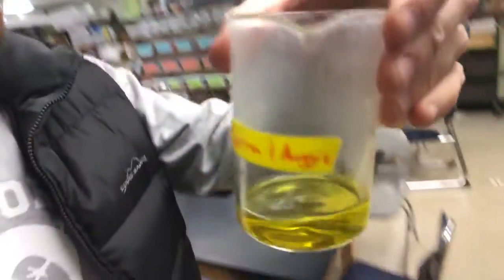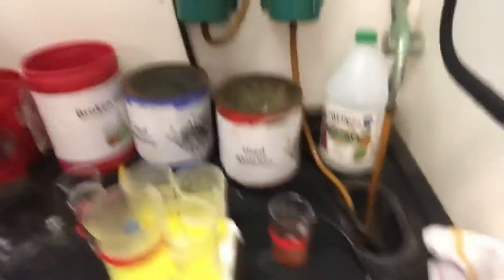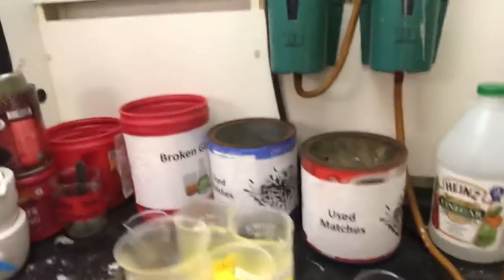So anyway, the empirical formula lab. Whenever I saw you guys last, you put some zinc in some hydrochloric acid. The zinc reacted and dissolved — there was a reaction that took away all the solid, so all that was left was liquid. I've got some here — this is Sierra and Augie's — and if you look at it closely, there is no solid at all left. It's been sitting here all week and I've actually got it on the hot plate right now.